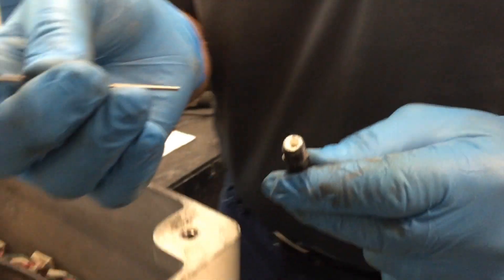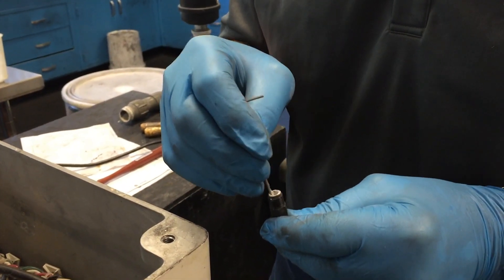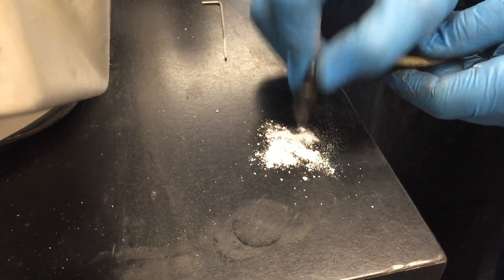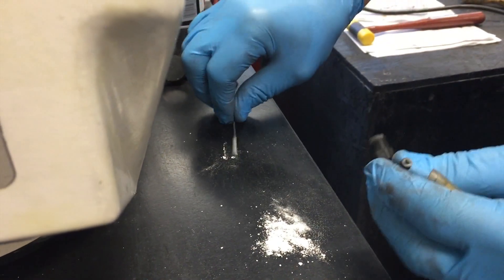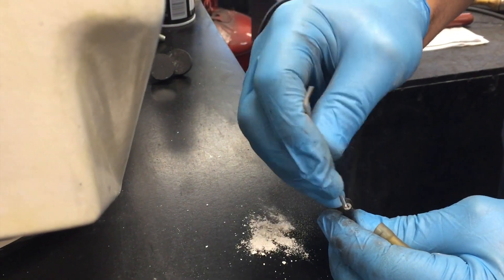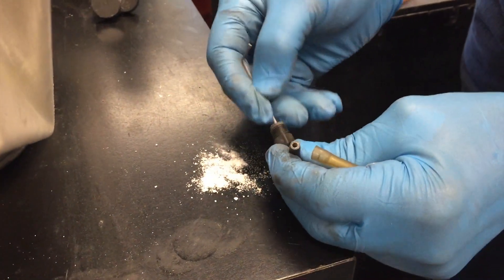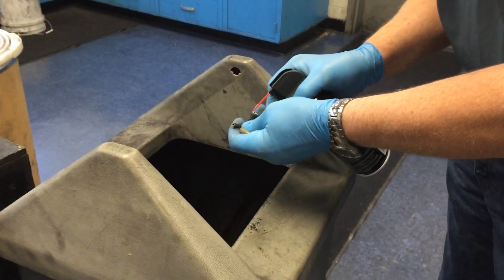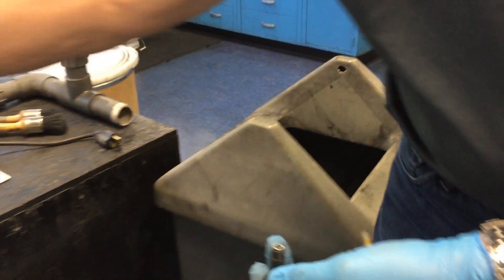In order to do that, we're going to use just a very small Allen wrench. However, a paper clip can be used. This is the kind of material that can be built up — this is rather common. You want to make sure that the hose is off both ends, the barbed end as well as the filter. Then use your canned air once again and blow that out.